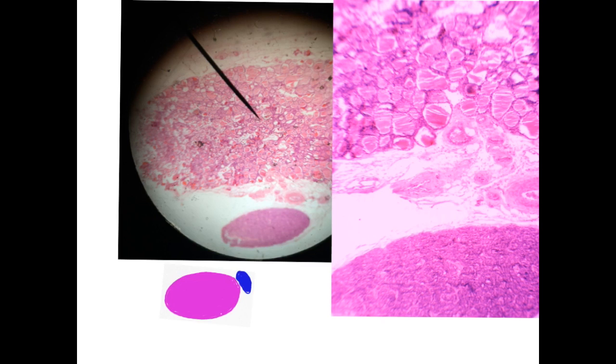This slide is also a compound slide. It is for the thyroid and the parathyroid. The thyroid is the big mass, more lightly stained compared to the small dark one. There may be 1 or 2 parathyroid masses accompanying the section of the thyroid. By looking under the microscope, it is easily diagnosed, as the thyroid follicles are very easy. They are filled with the pink colloid material inside, and the parathyroid, as you all know, is formed mainly of basophilic cells, which are the principal cells.